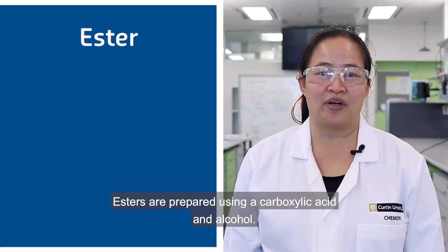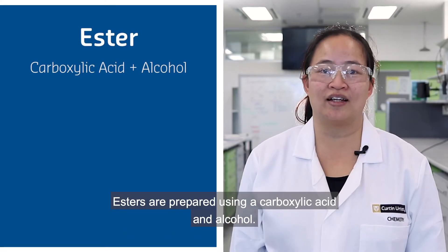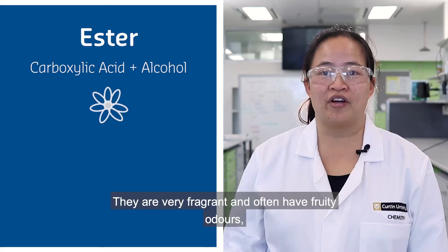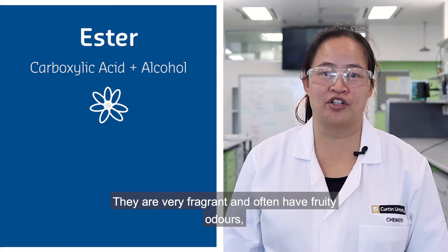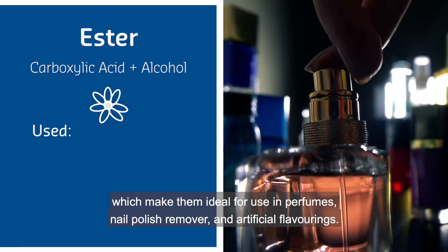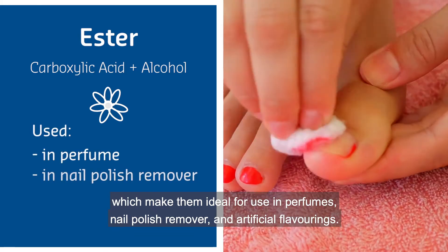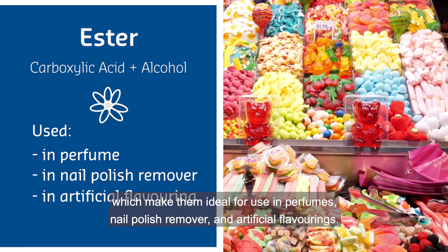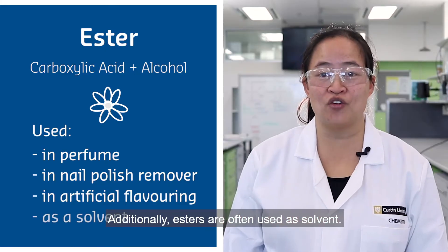Esters are prepared using a carboxylic acid and alcohol. They are very fragrant and often have fruity odours which make them ideal for use in perfumes, nail polish remover and artificial flavourings. Additionally, esters are often used as a solvent.